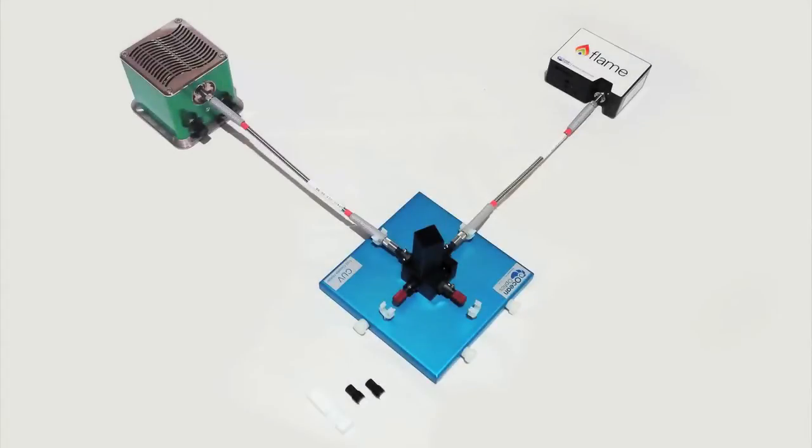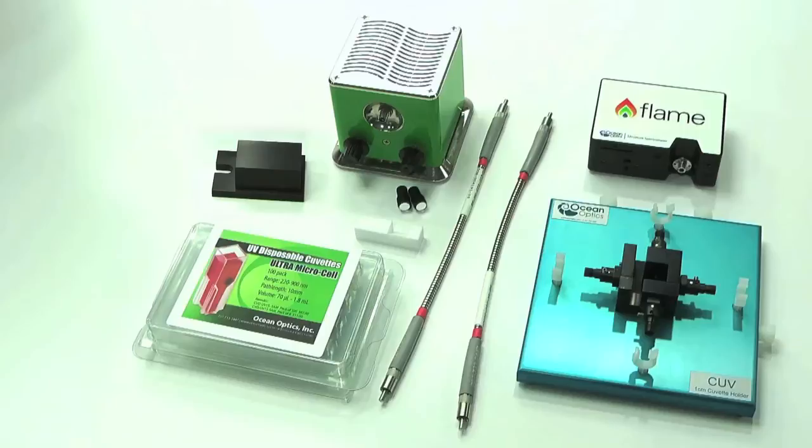In this video we will demonstrate how Ocean Optics products can be used to perform a fluorescence measurement. We will use products available in our fluorescence bundle.